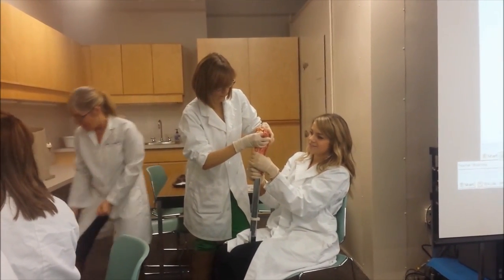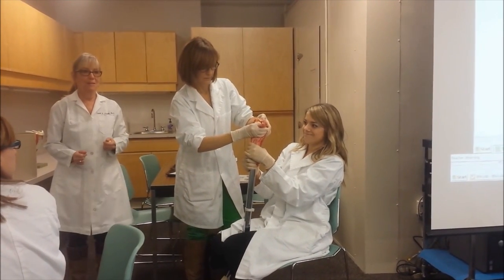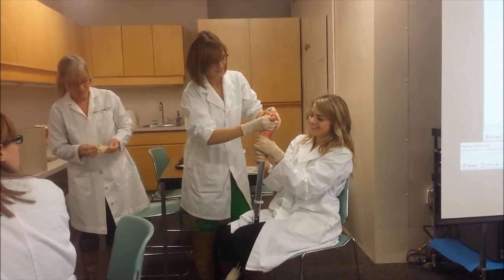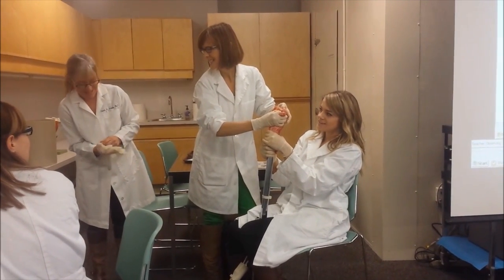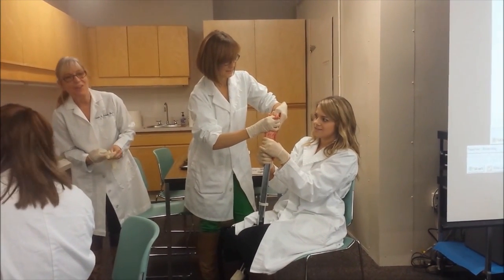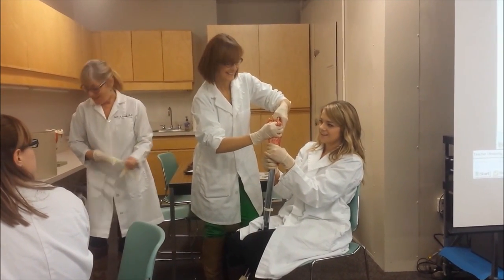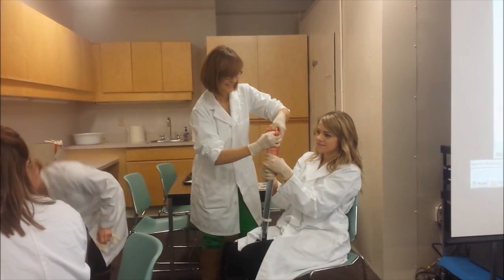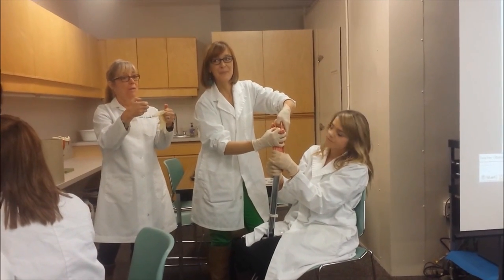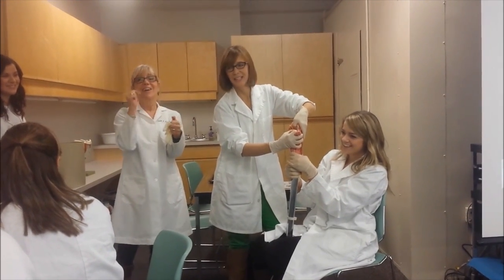We're going to start the air source. So that's the basic vibration. What did you hear Ramda do? She adjusted the pitch by acting like the cricothyroid.